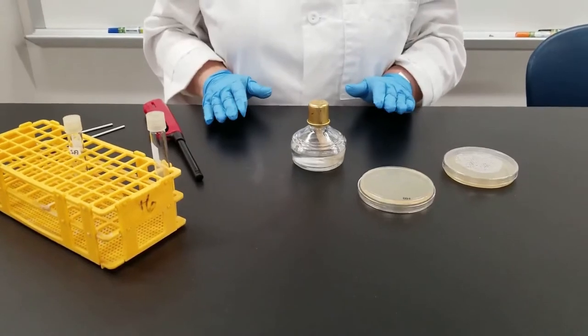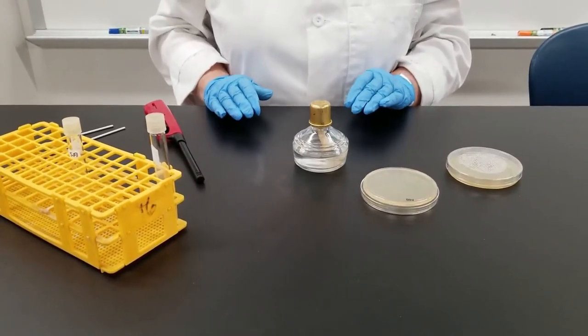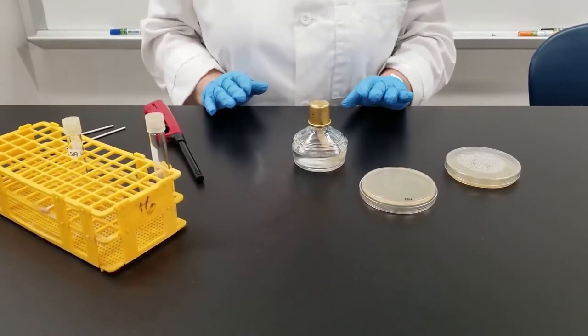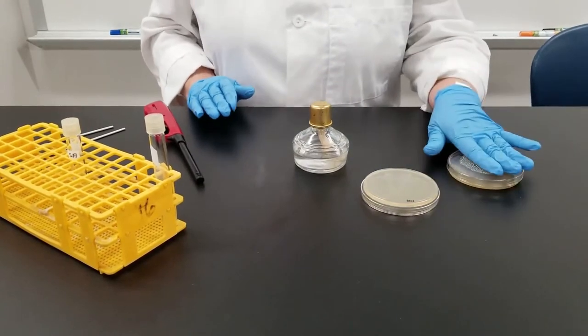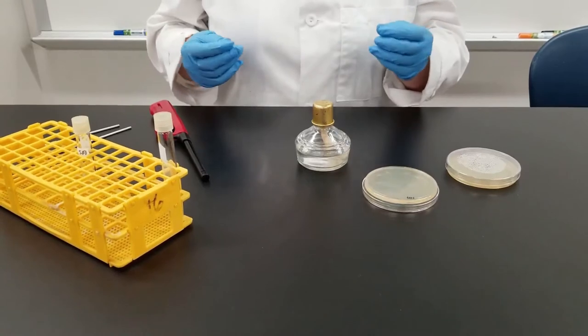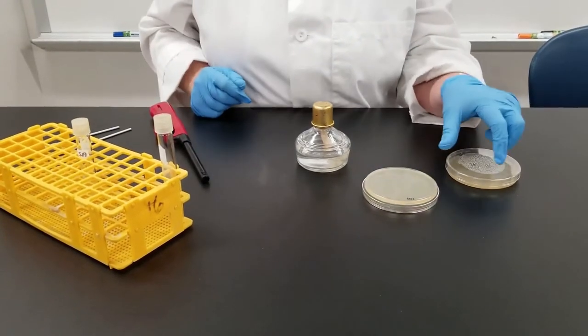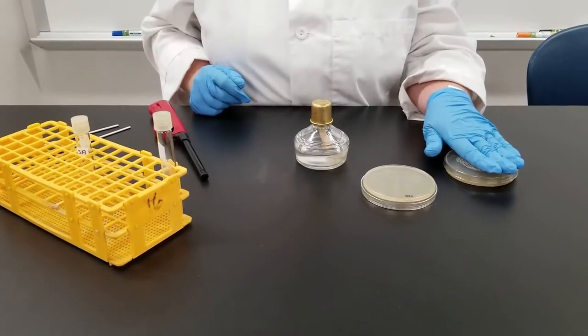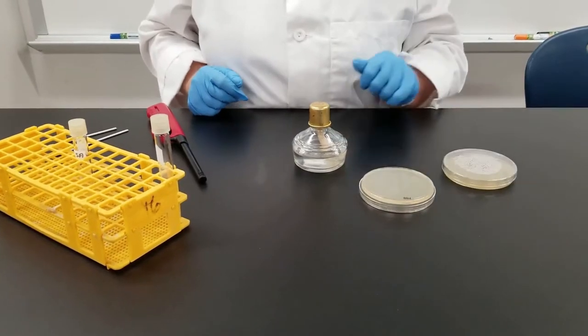Okay, today I'm going to show you some different transfer techniques that we use in microbiology. So to start with, some cultures will be grown on a petri dish. It's a hard agar, kind of like a gel type consistency. So it's a hard medium that we will grow cultures on.